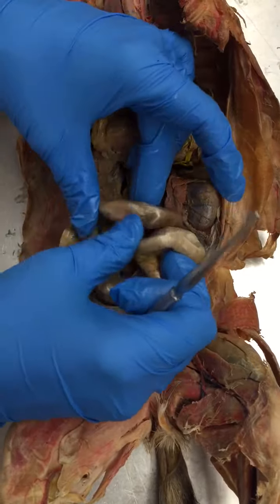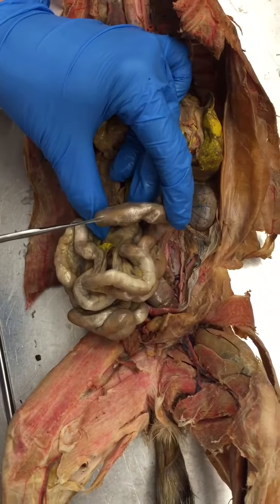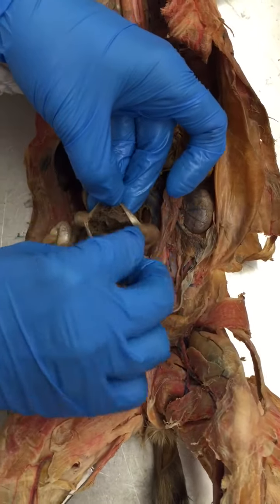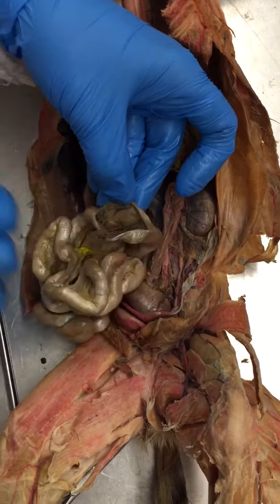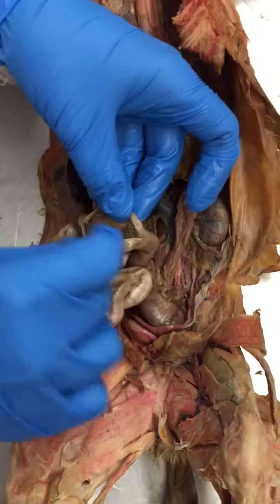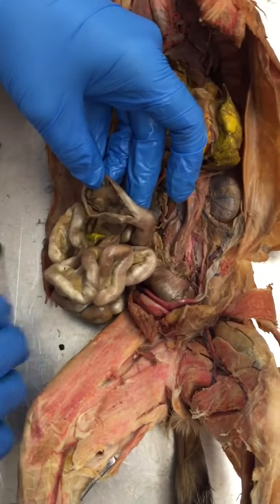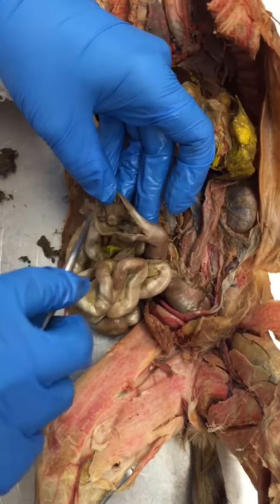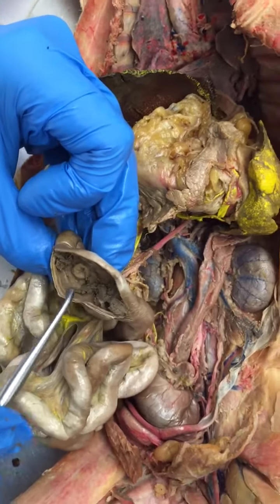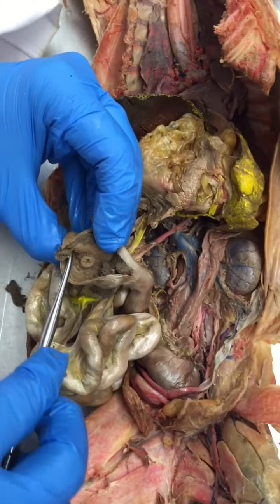We'll open this up now to see the ileocecal valve. We'll cut through the cecum, remove the fecal material, and we should see our nice little ileocecal valve, which looks like a little donut — or a belly button — right there. That is very small. There is your ileocecal valve, and then the cecum is down here.